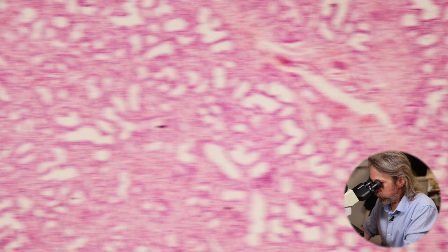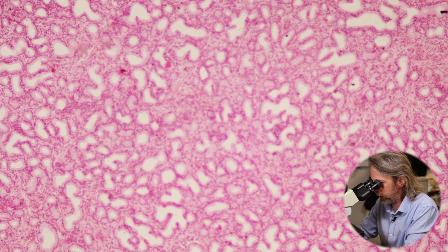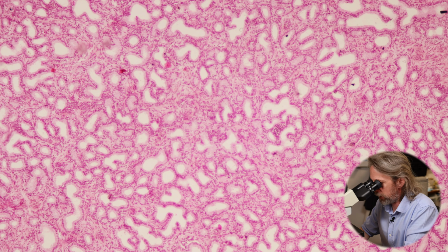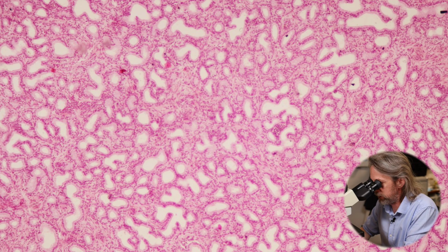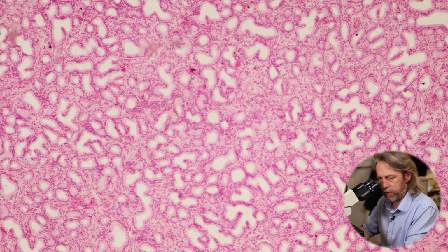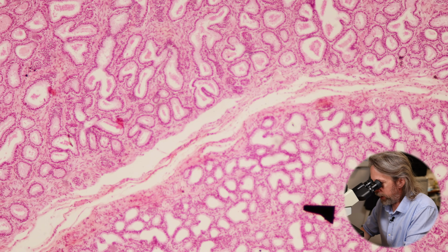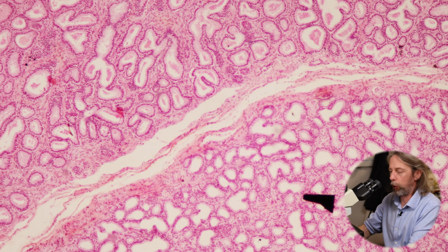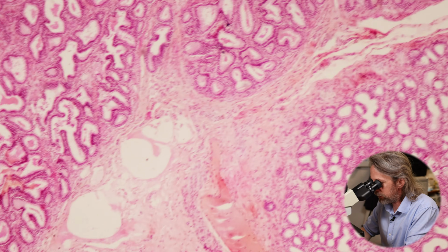And we're seeing a lot of tubes. So that's the glandular tissue that we're looking at there. The glands are branched. The cells are making the secretory products and passing them into the lumen of those glands, of those ducts. And actually, there I can see a boundary between 2 parts of the prostate. So the prostate is separated up into lobules like many glands are. So there's a dividing part there.